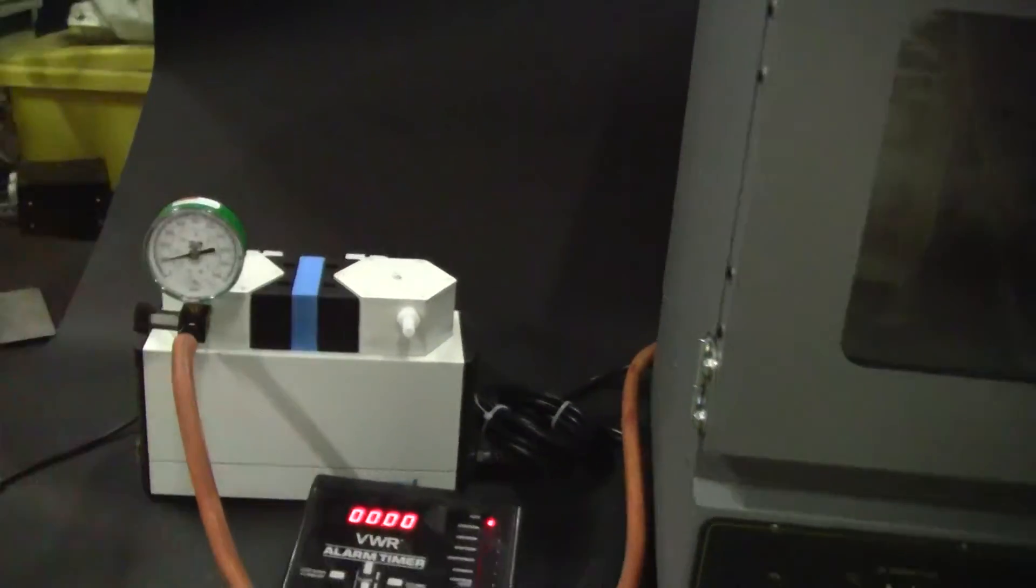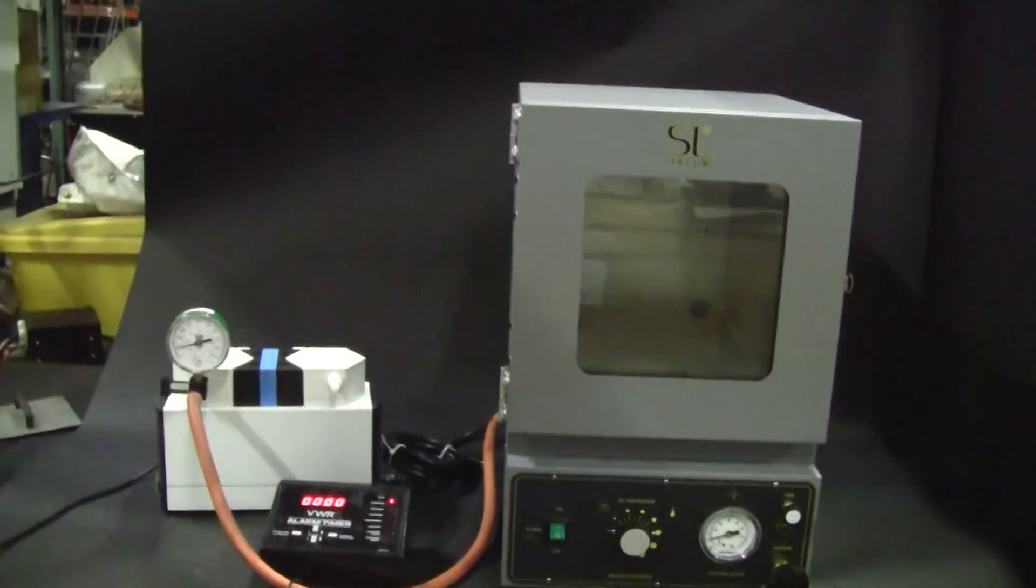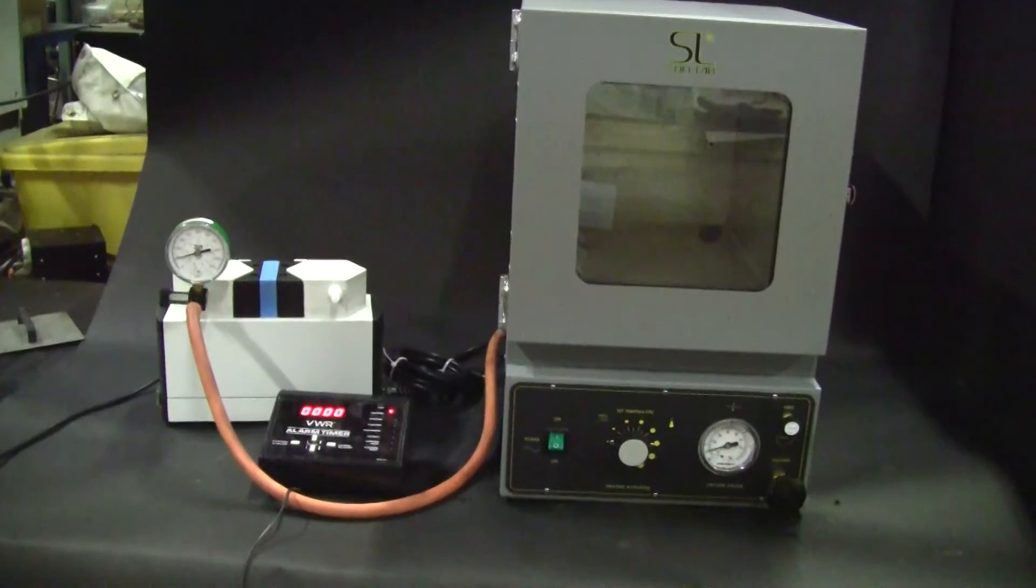What we're showing in this video is that we have pulled a vacuum, and the vacuum is holding quite nicely. We have about 100 millibar.